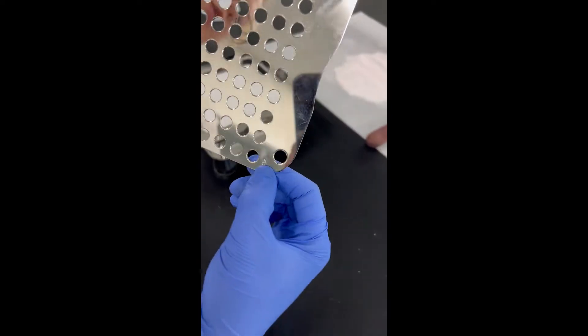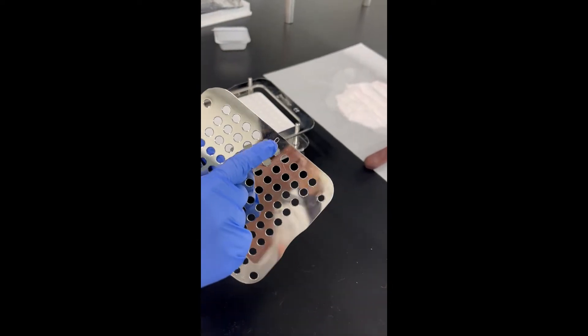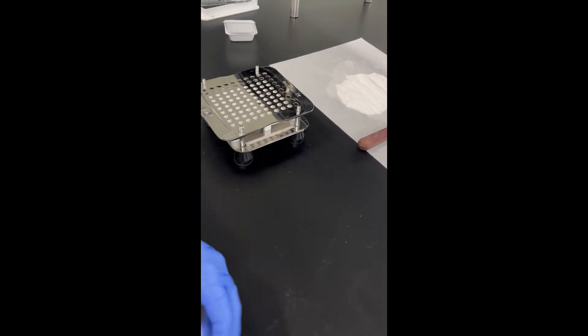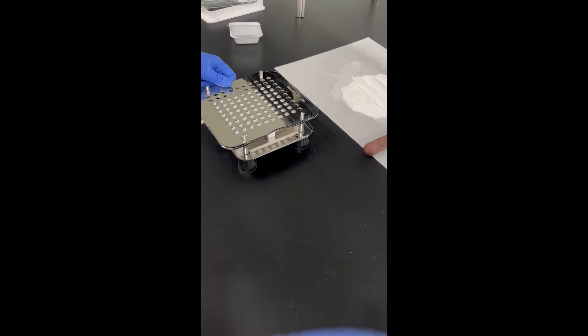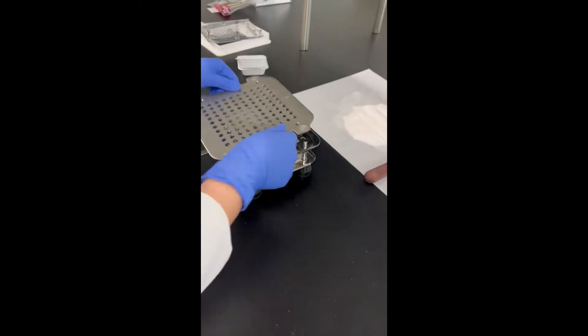As you can see on the bottom of the plate, it's going to be A first, and you also have your zero up here which is always pointed towards the top. Put that one on, then you have your B, then your C — and your C is also going to be a lot thicker and heavier.